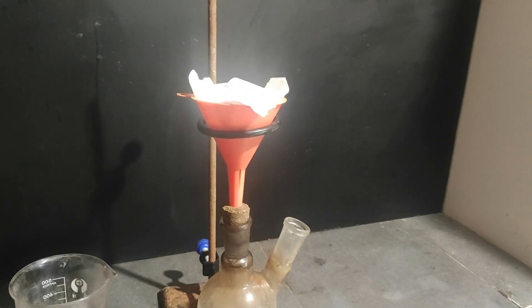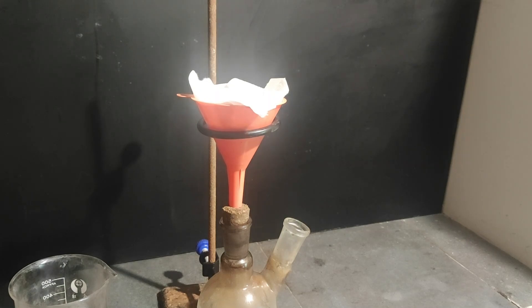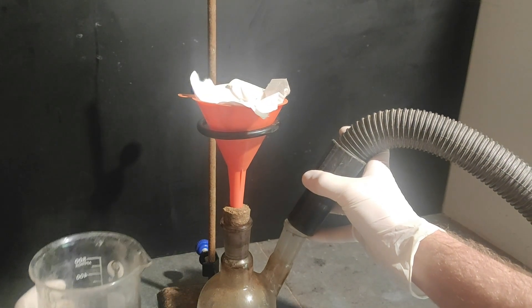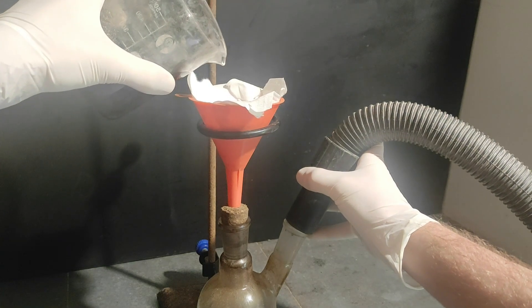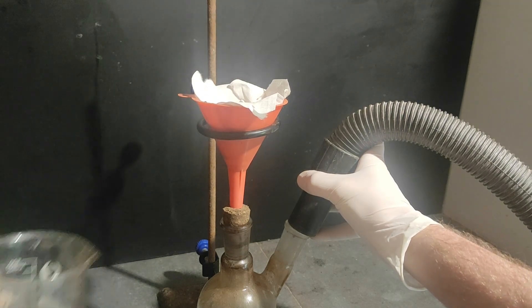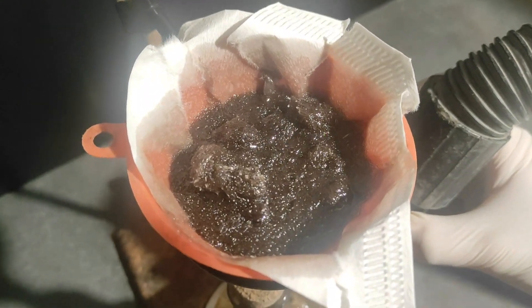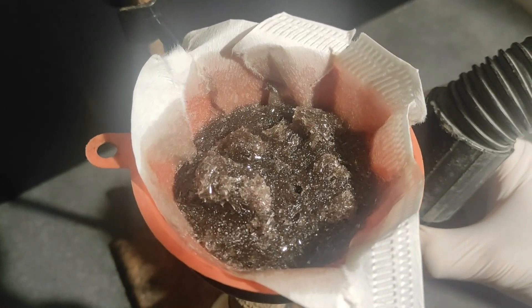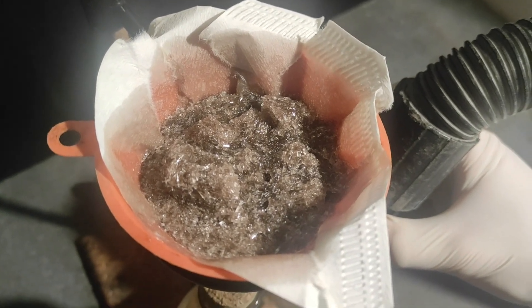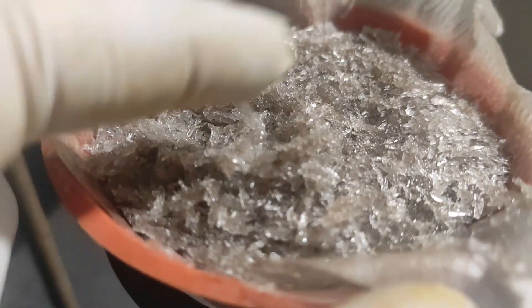Now I'm going to activate the pump, so you're not going to hear me at all. As per usual, I set up my shitty vacuum filtration setup. It consists of a strong vacuum cleaner — which is still a weak vacuum, but whatever — and a funnel with a plastic grid that I made by melting some plastic, so it acts like a professional setup but just everything worse. As you can see, it still sucks the water nicely and leaves us with some good-looking crystals, even though they are a little bit dark. So that was step one of this ambitious synthesis. We have made para-toluene sulfonic acid, despite some issues with the siphon setup.